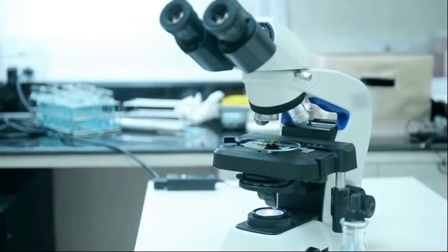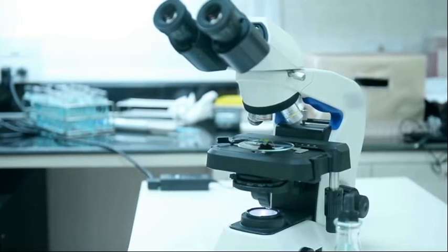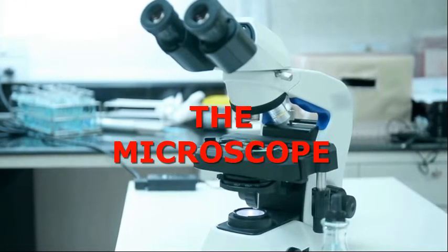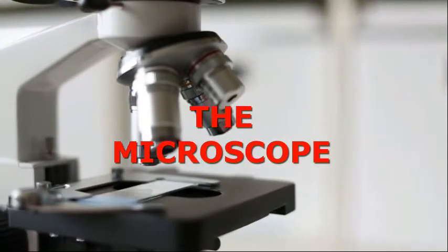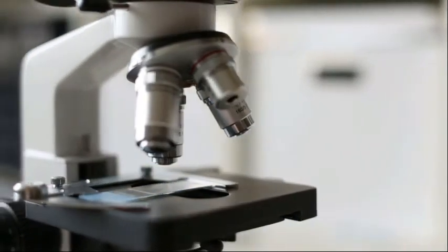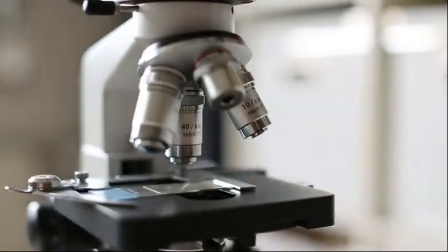Another important subtopic we're going to be discussing today is the microscope. As we've said before, it is important for us to know about the microscope because when we discuss cells, cells are microscopic and cannot be seen with the naked eye, so we have to employ the microscope to be able to see a cell properly.